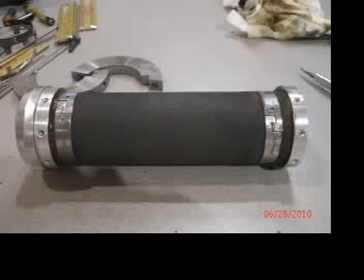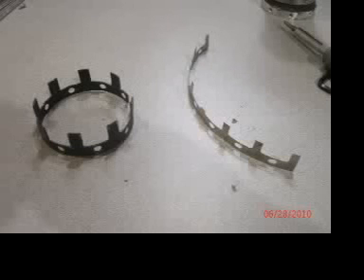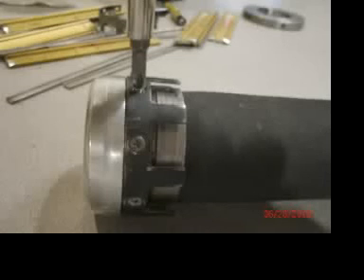Now you have the next hardest problem, and that is actually putting the outer shell back together. For this, there is a fairly heavy ring that's shaped like a crown, a much lighter ring that seems to be made out of Dr. Blade material, and 9 tiny screws. Note that the ends of the leaves are different. The tapered end goes toward the operator side, the square cut end goes toward the gear side.